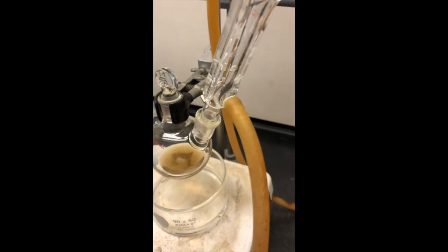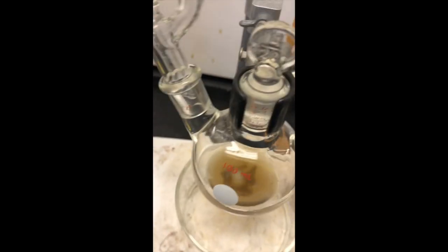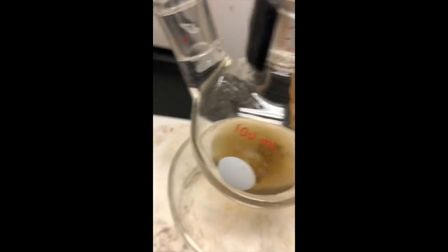You notice also we now have our water going because the reflux is quite strong, and even when it's not in the water bath, it is boiling. It does create its own heat. You can see that.